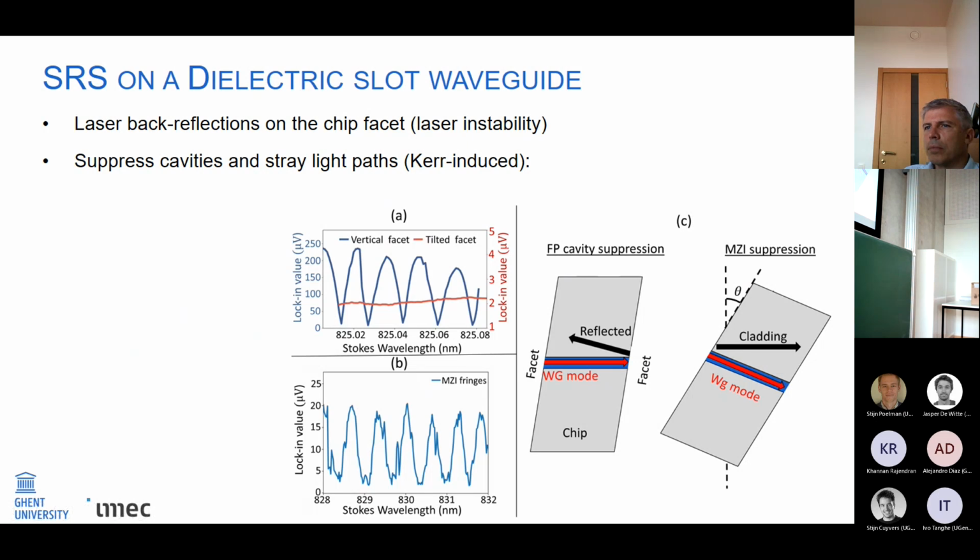In the same way, you can actually also have a formation of an interferometer because you couple light into the waveguide, but also part of it can couple into the cladding mode. And at the end of the chip, you actually can have interference between the cladding mode and the waveguide mode. And that led to these fringe patterns that you can see here.